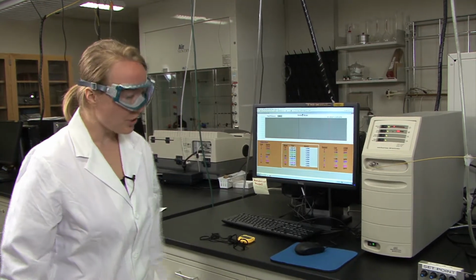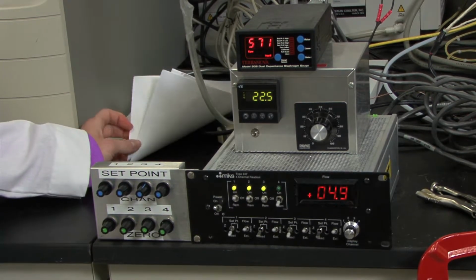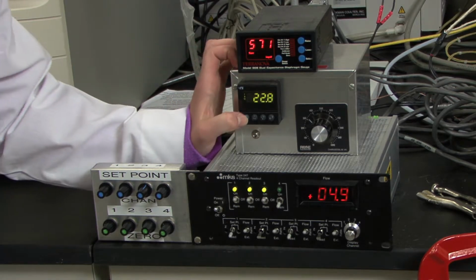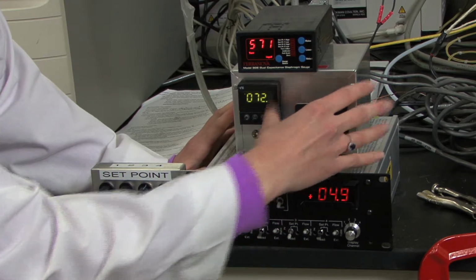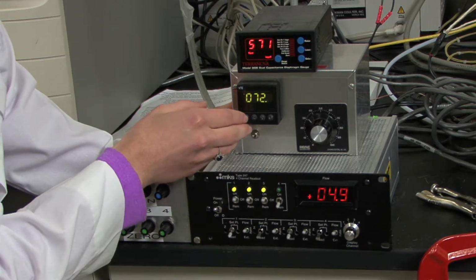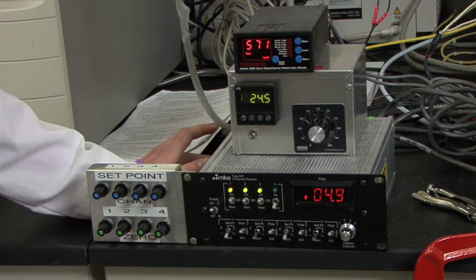So to do that, you will turn on the temperature adjuster, and then set the temperature to what is desired. So you'll need to do at least 5 temperatures, and the first one should be less than 100. So to set the temperature, you'll want to press the return arrow and then the arrow on the right-hand side to set it, and then use the up and down arrows to set it to the appropriate temperature. And then when you're done, you will hit return again, and then the circular arrow twice until it comes up with run, and then your temperature will start to heat up.